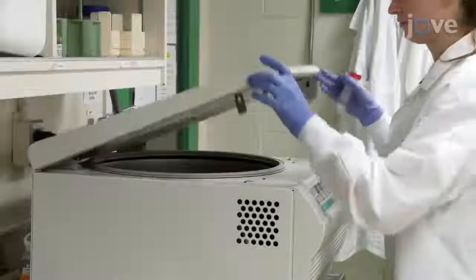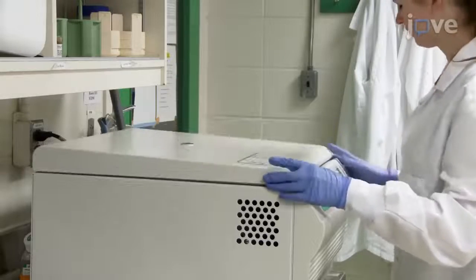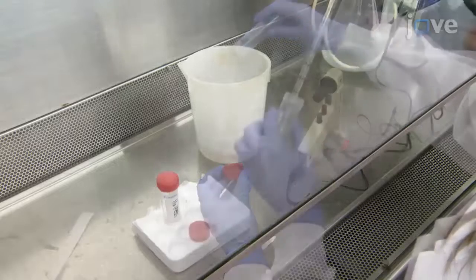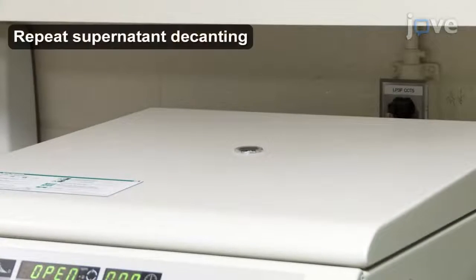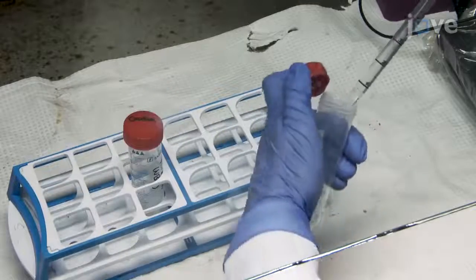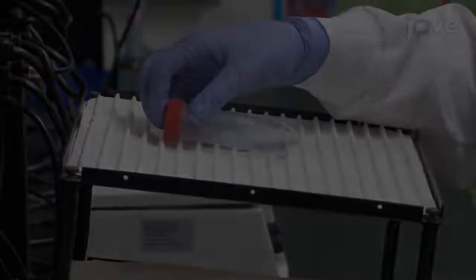To begin, centrifuge the previously harvested cells in a 50 milliliter conical tube at 225 Gs for 5 minutes. Decant the supernatant and resuspend the cell pellet in 10 milliliters of PBS. Then centrifuge the resuspended cells at 225 Gs for 5 minutes. Suspend the cell pellet with 10 milliliters of 10% NBF. Then incubate the cells at room temperature on a rocker.